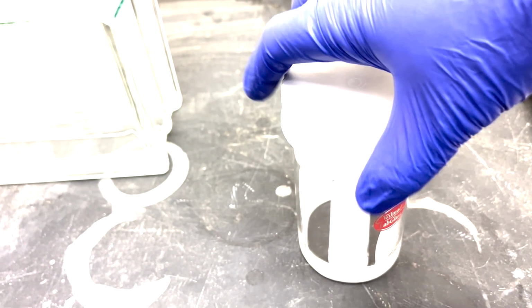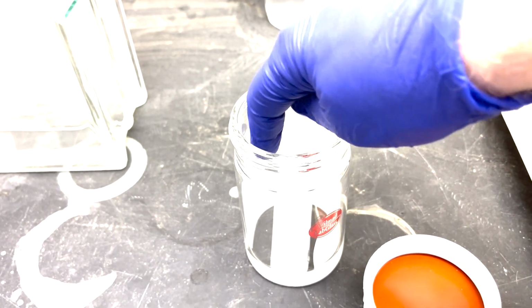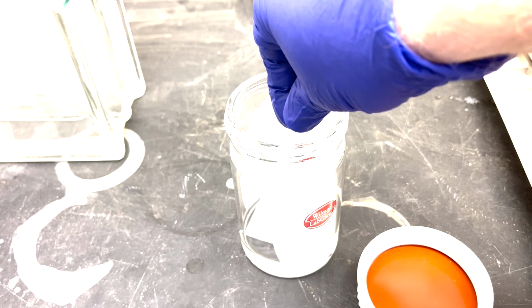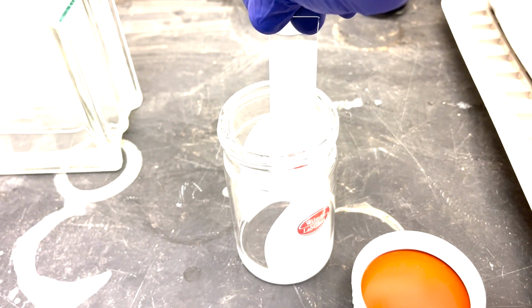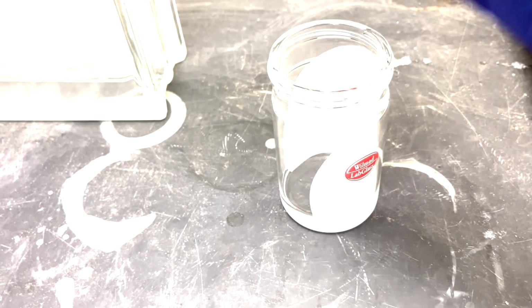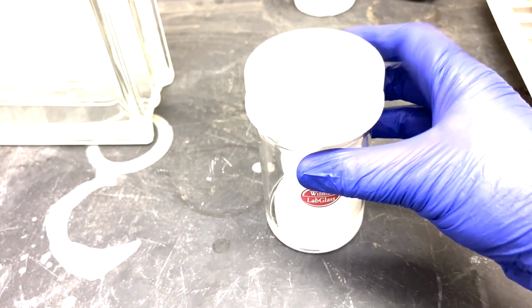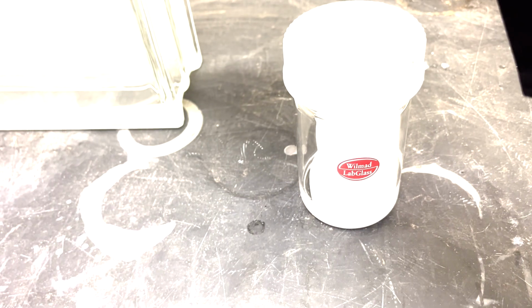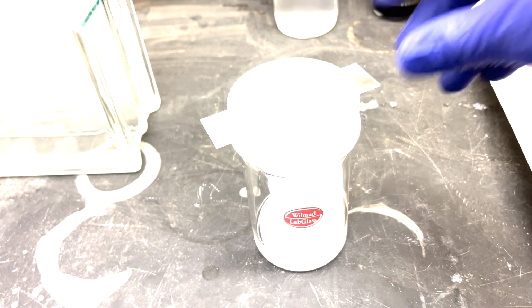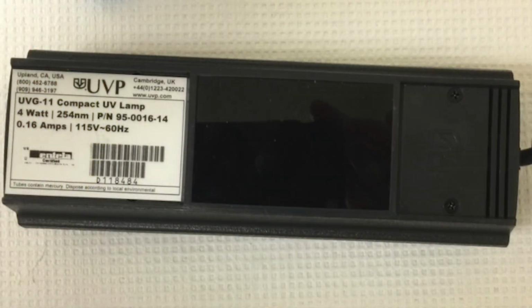When the run is done, you're going to take the plate out, and again, here you must have patience. Let the plate dry in the hood completely. Take the plate out, get the dripping stuff off of it, and then set it on something with the silica side up and let it dry completely in the hood. Your development, that is to say, the visualizing of the spots, is going to be severely hindered if you do not let it dry completely in the hood.